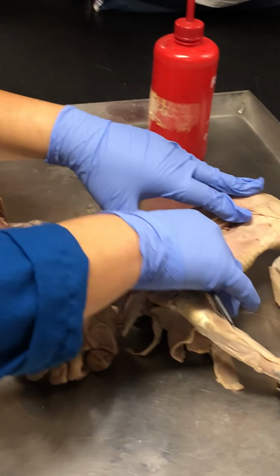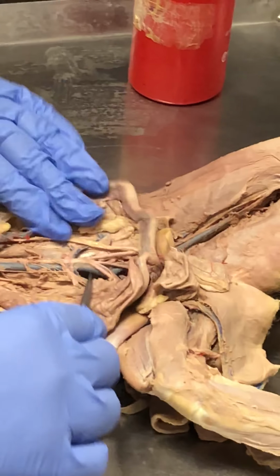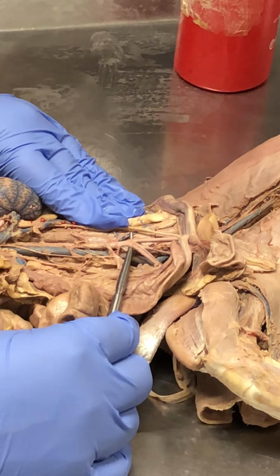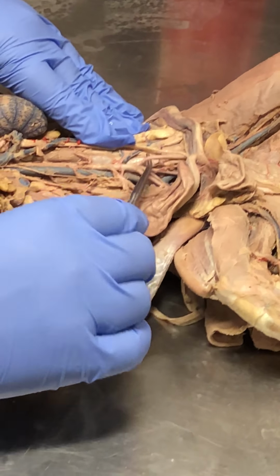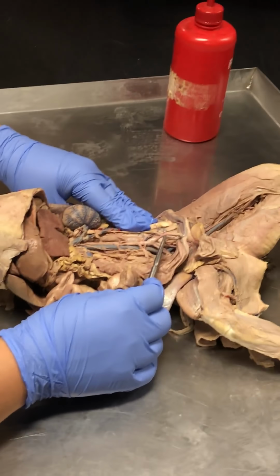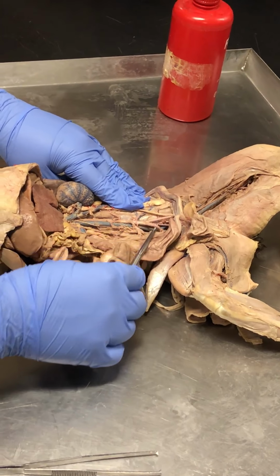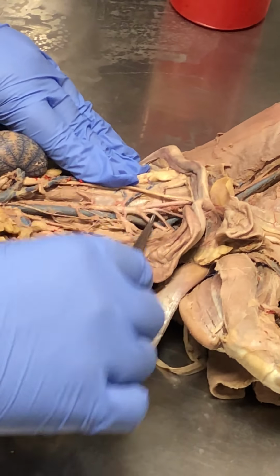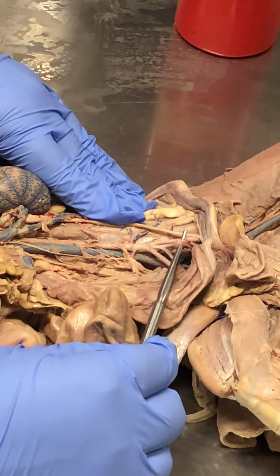And then finally, I want you to take a look at inside this region here so that you can see all these vessels. So you come to the terminal end of the artery right here. That's the descending aorta, correct? Well, notice how it splits. One thing you'll notice is that cats, this vessel here, you would think this is the common iliac. No. Cats don't have a common iliac. This is the left external iliac artery on the cat. And this is the right external iliac artery. There is no common.